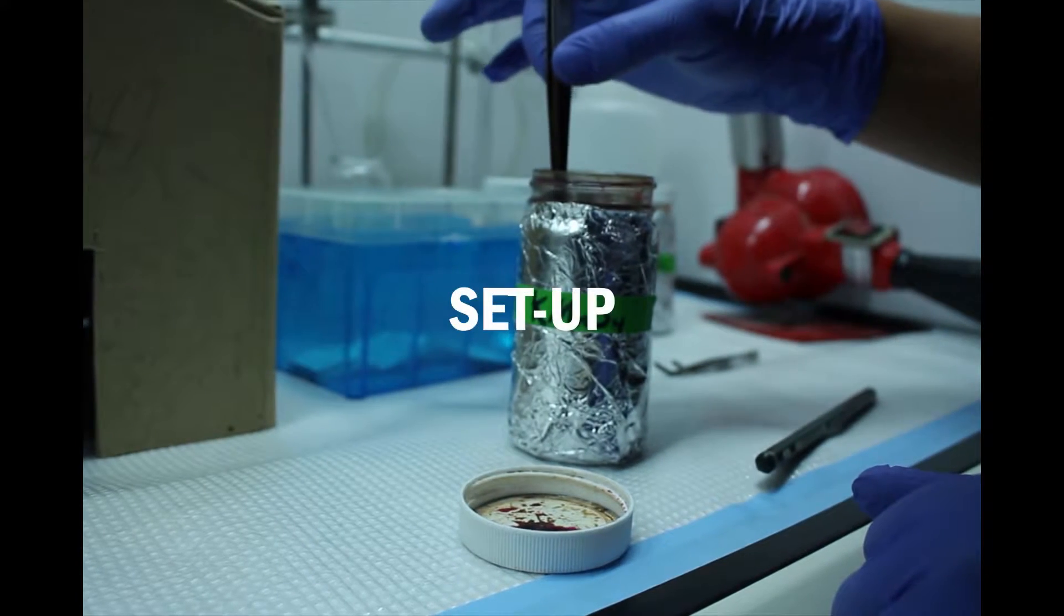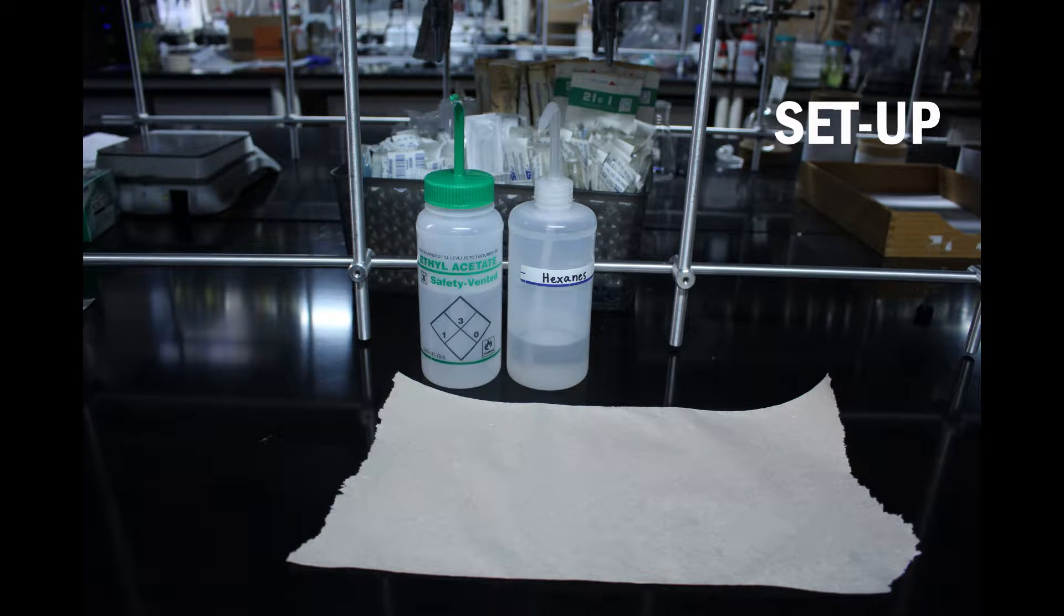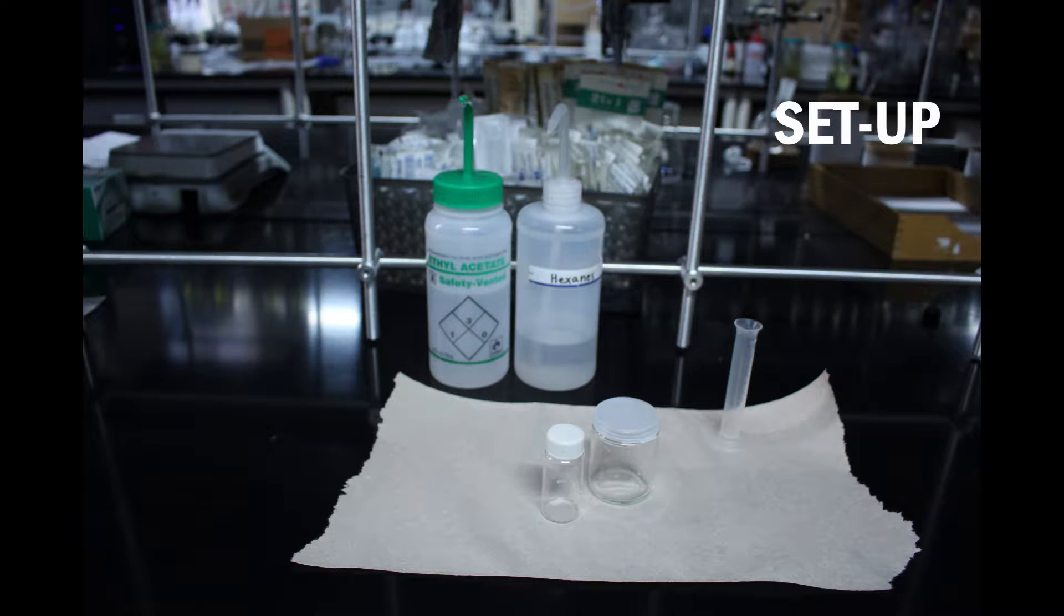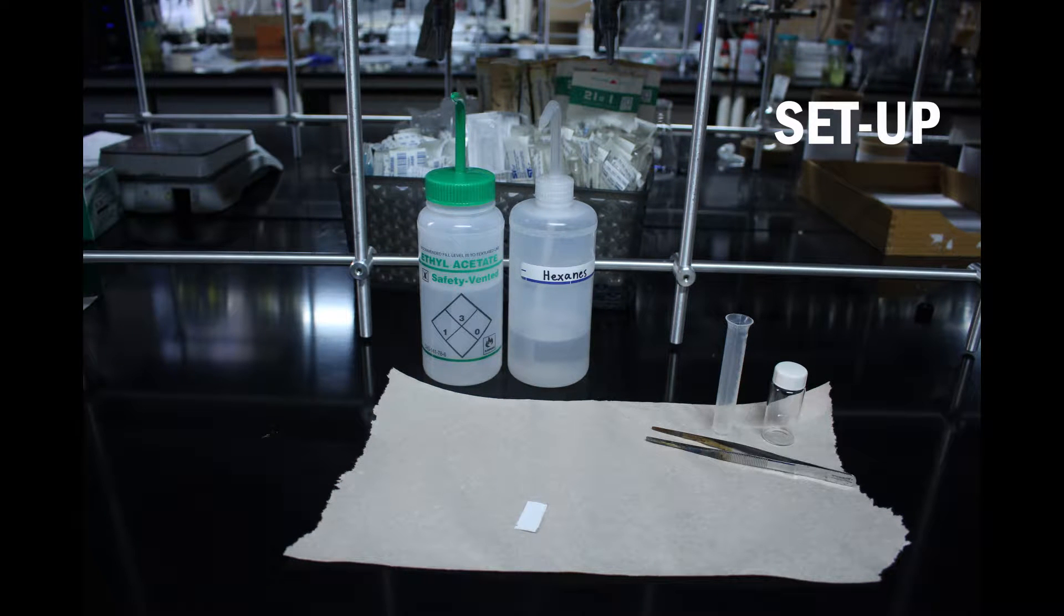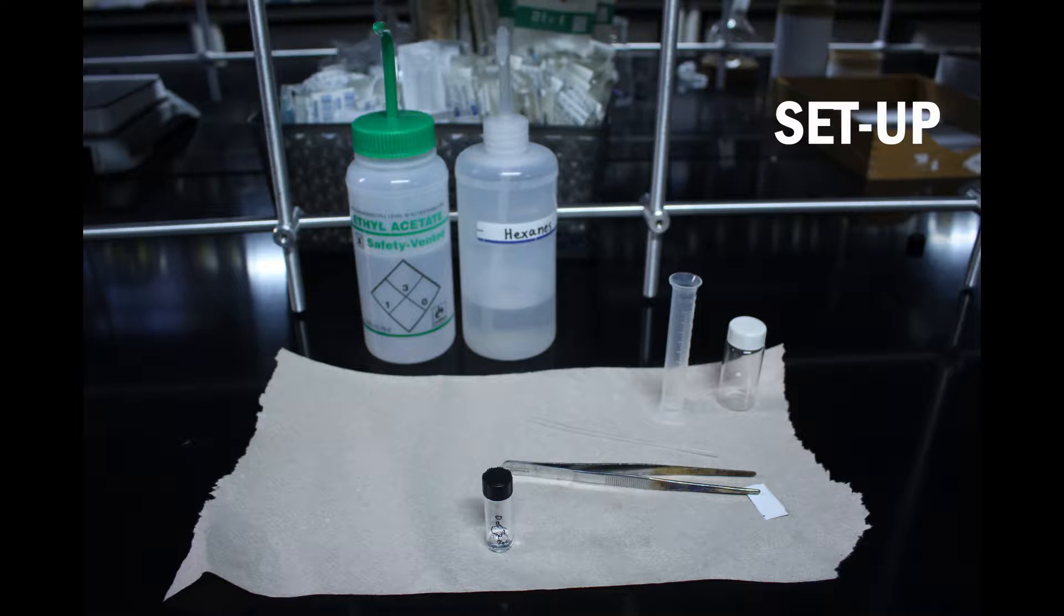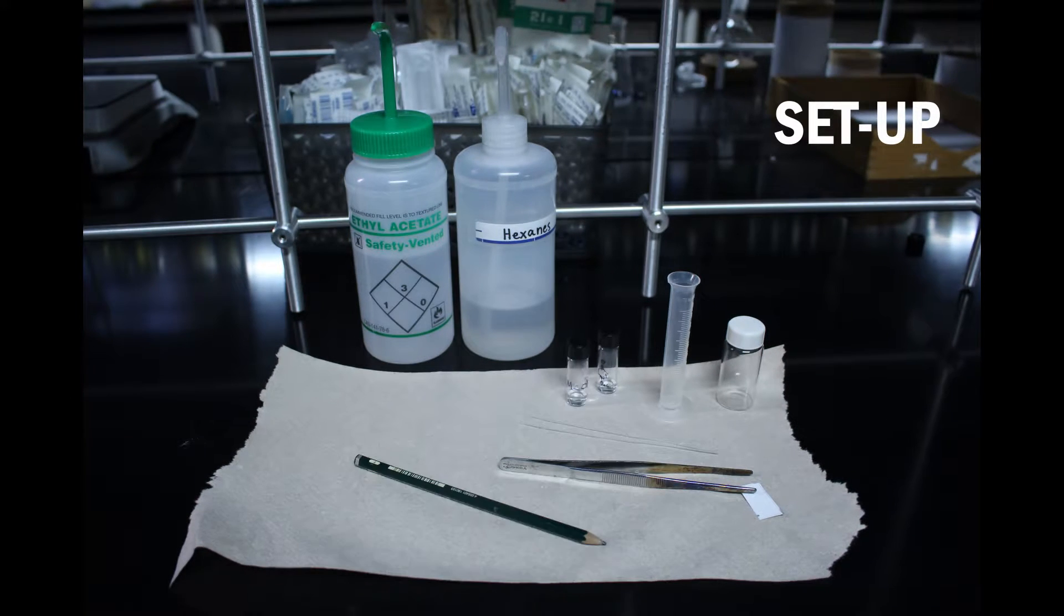Setup: Paper towel, solvent, 10 milliliter graduated cylinder, TLC chamber or scintillation vial, tweezers, TLC plate, spotter or capillary tube, starting material, vial of solvent, wooden pencil.